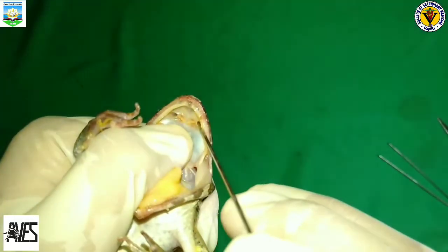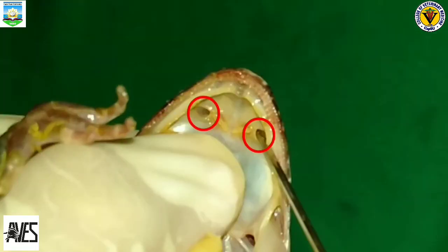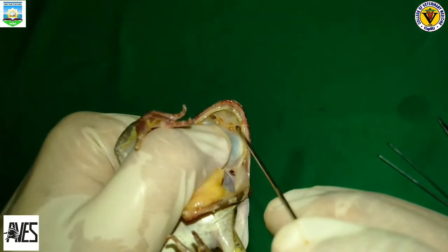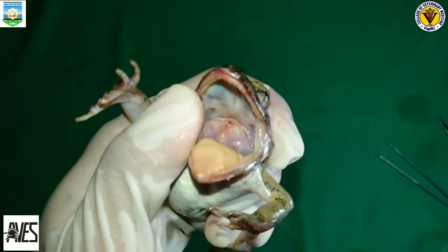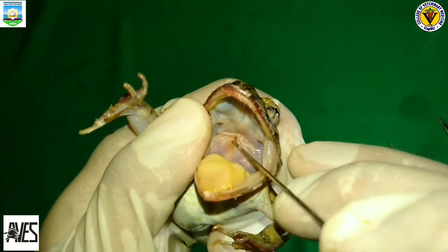We can see the internal nares of the frog here. Frogs' internal nares are located on the roof of the frog's mouth. They connect the nostrils to the mouth. Air is drawn into the internal nares from the external nares, then passes through the mouth, through the trachea, to the lungs. This is the esophagus of the frog. It is located at the center of the mouth. Toward the back is a single round opening. This tube leads to the stomach. The esophagus has no main function but to transport food.